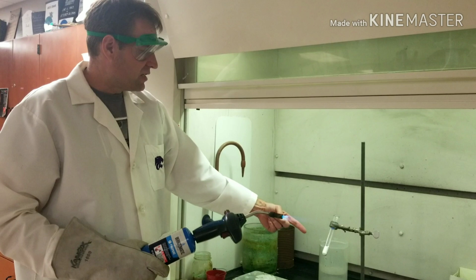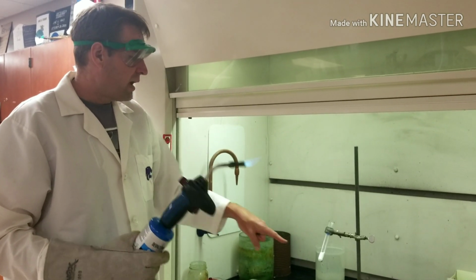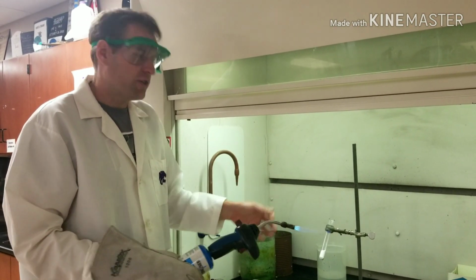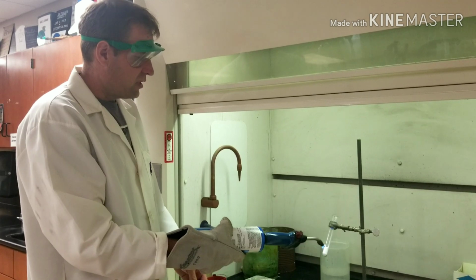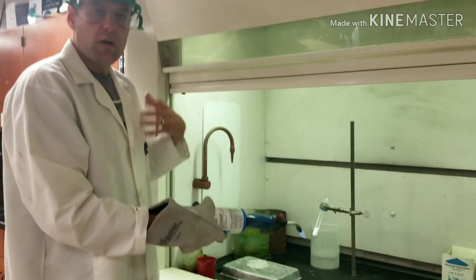We have our potassium chlorate in a test tube. I've got the torch of science here, and we're going to decompose the potassium chlorate, and the products will be potassium chloride and oxygen gas. So that is what we're doing right now. We're heating up the potassium chlorate. It's going to turn to molten potassium chlorate, and then we'll start decomposing.